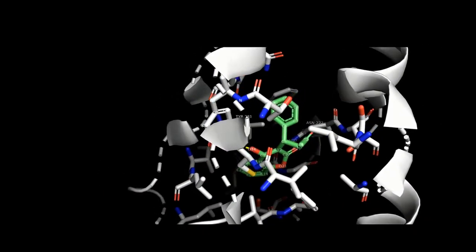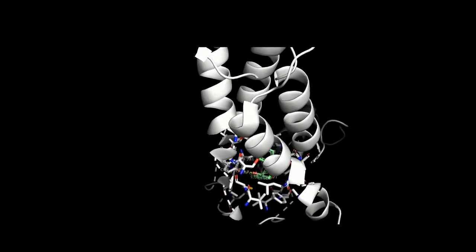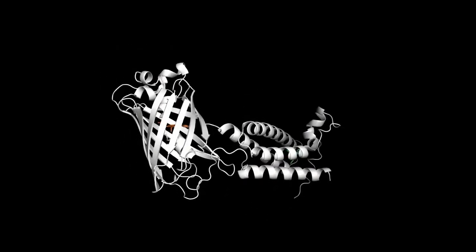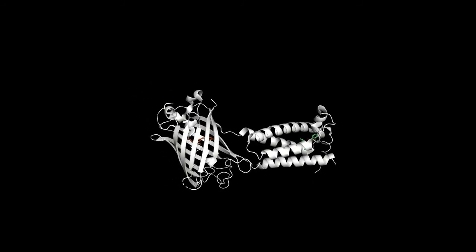Therefore, no active clotting factors form, which in turn leads to the blood not being able to clot inside blood vessels. Hence, thromboembolic diseases will be prevented as the blood is not able to clot, showing how important warfarin is in preventing these conditions.